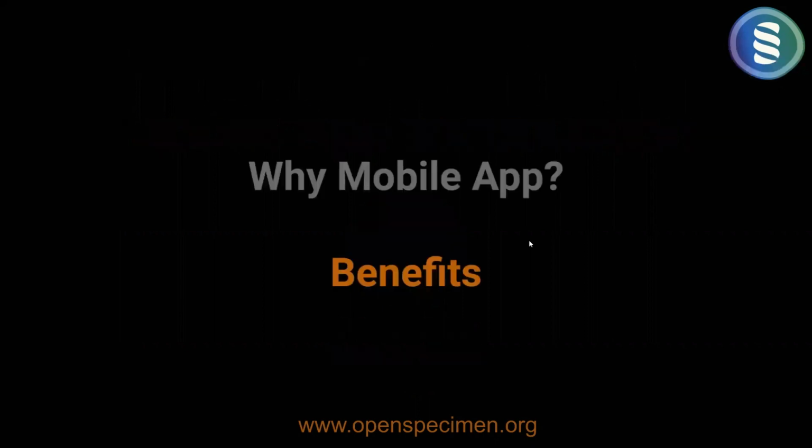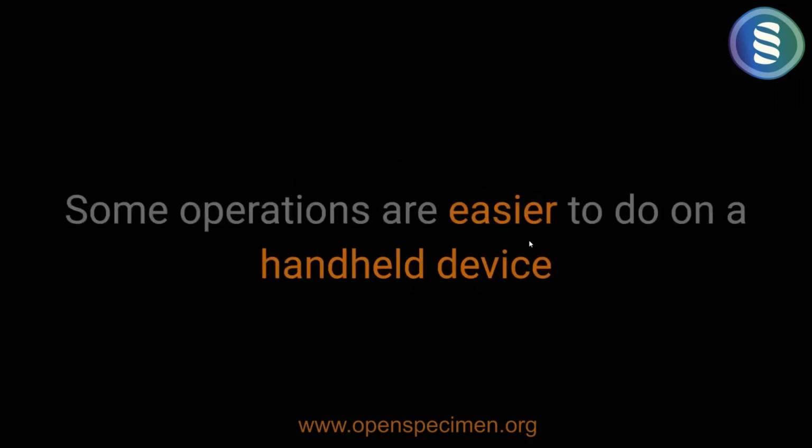Before we get started with seeing what we have done, let's first try to understand why a mobile app is useful in the context of OpenSpecimen. Not all operations, but some operations are easier to do on a handheld device.